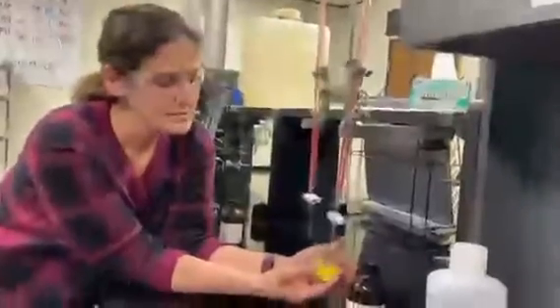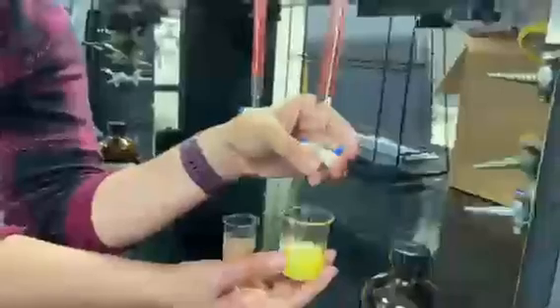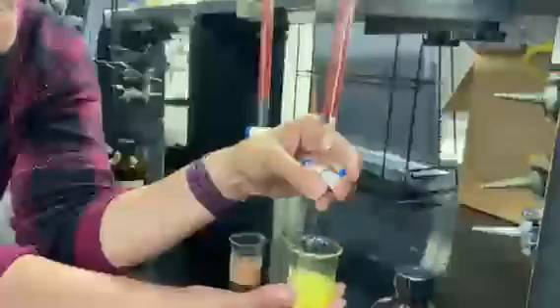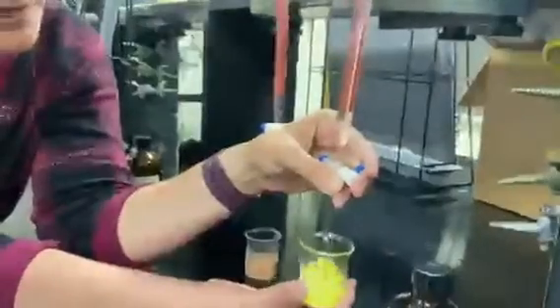Again, try to get that dropwise going. You already see the cloudy, see some flashes. Okay, I'm going to speed up my drops if I can. Again, you've seen those flashes. It's a good sign, but we really need it to persist. Doing a fast drop, but not too fast. And try not to over swirl. Yes, this could always be done using a stir plate, but I'm always worried about breaking burette tips if they get too close.